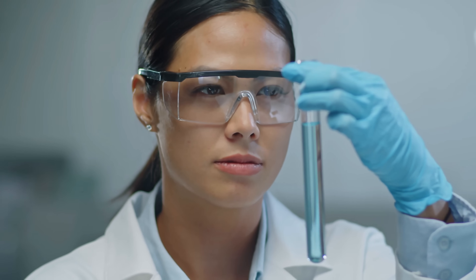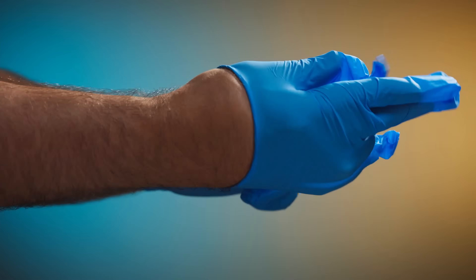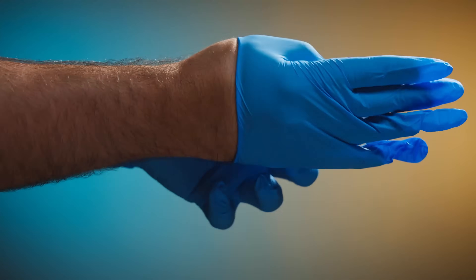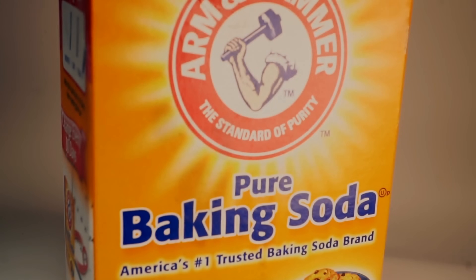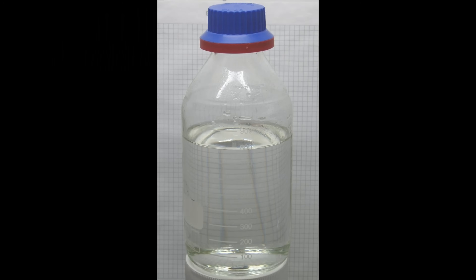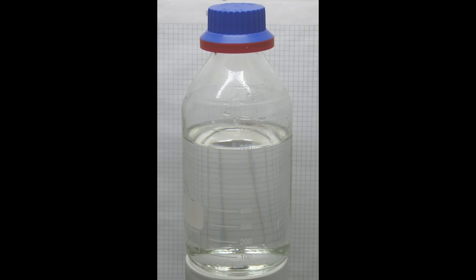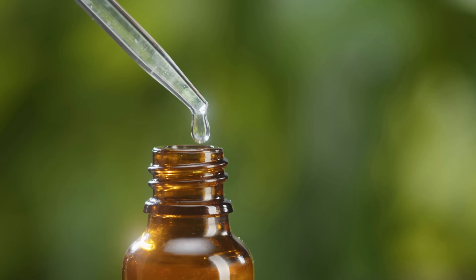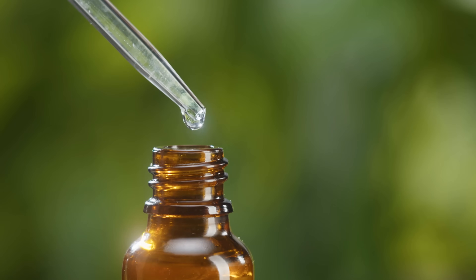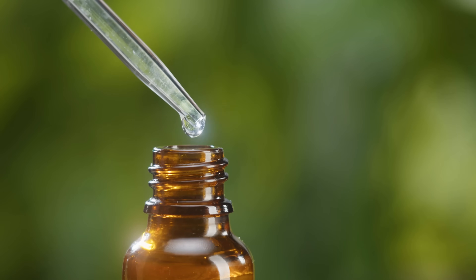This is an acid test. When you do this, wear safety goggles to protect your eyes, use nitrile or latex gloves, and work in a well-ventilated area, preferably outdoors or under a fume hood. Keep baking soda — sodium bicarbonate — or water handy to neutralize any acid spills. We used hydrochloric acid at 10% concentration. Many commercial products labeled as muriatic acid are stronger and need dilution: one part acid to two or three parts water. You also need a pipette, your mineral sample, and a non-metallic tray or dish.